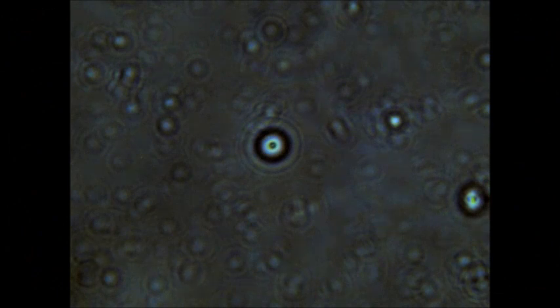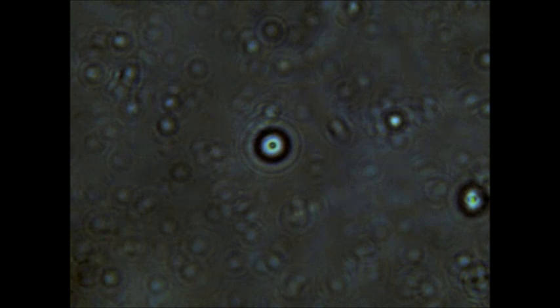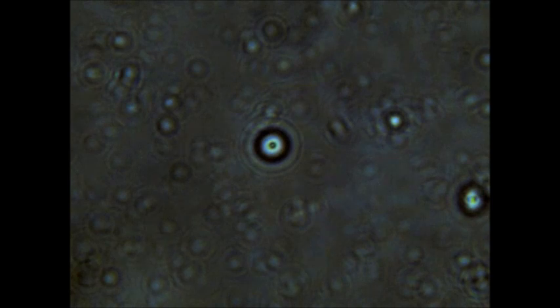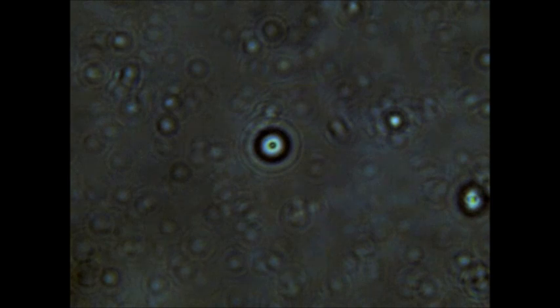I just wanted to post another video of another fatty acid vesicle which I found on the same microscope slide as the last one that I posted. I added a few drops of SYBR green stain to a solution of RNA, then mixed the RNA solution with a solution of fatty acids, and it certainly appears to me that the stained RNA has been captured inside the vesicle.